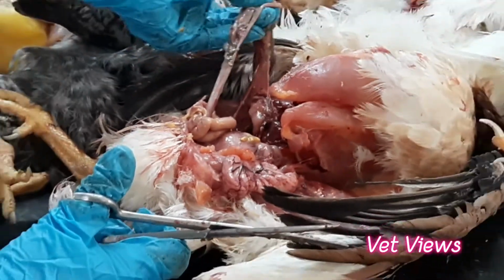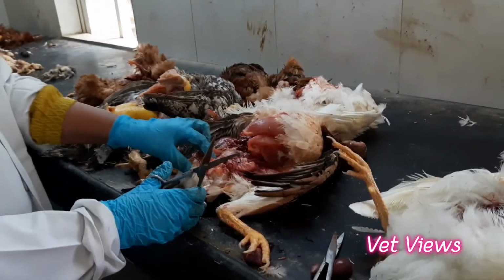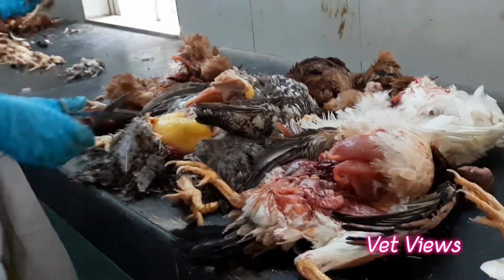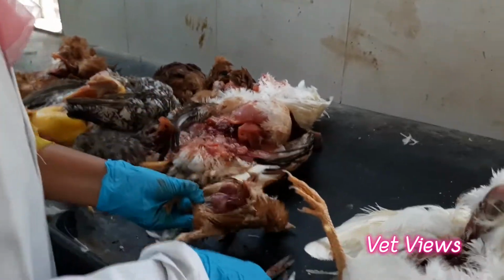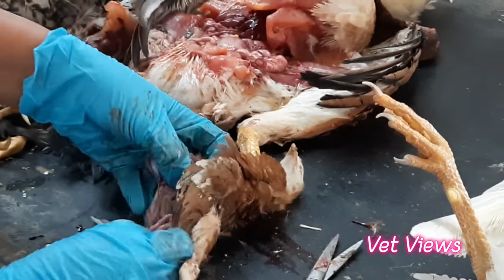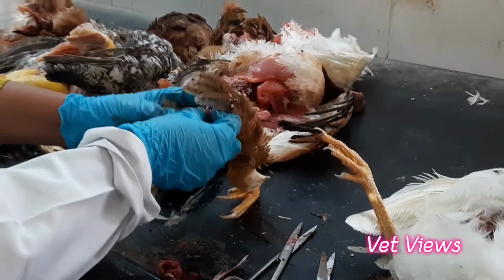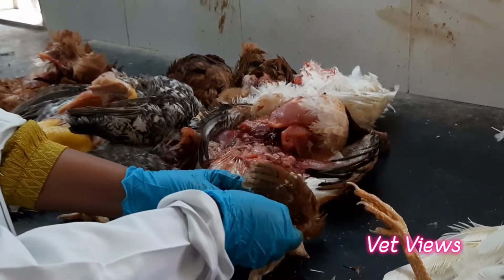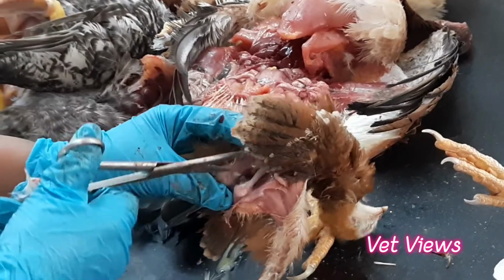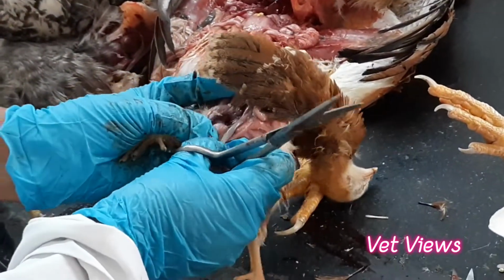Okay, this you have to see in the cecal tonsils. Cloaca will be there, and then in small birds you have to see the bursa. So two birds you can see. The bursa is an important organ. It is well prominent only in the young birds. In 3 to 6 weeks old birds, you can see it prominently, just where the intestine ends. In adult birds, they are regressed.